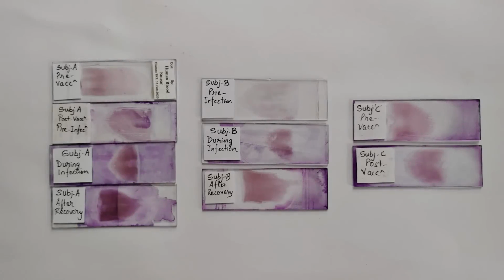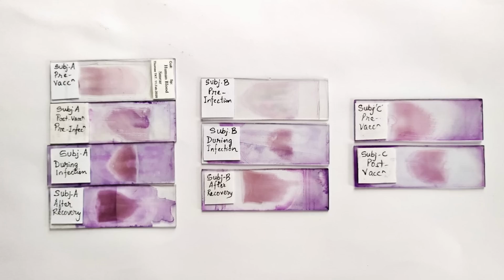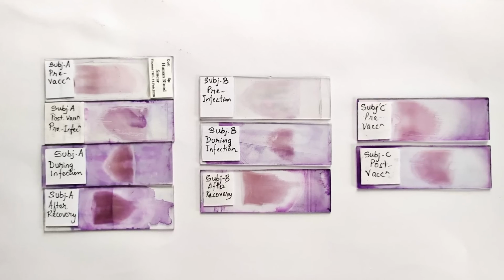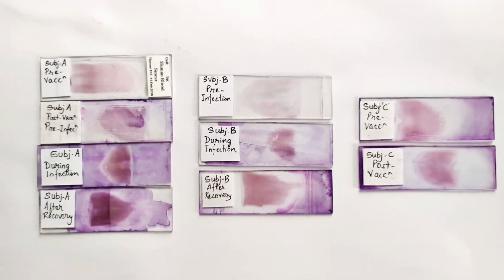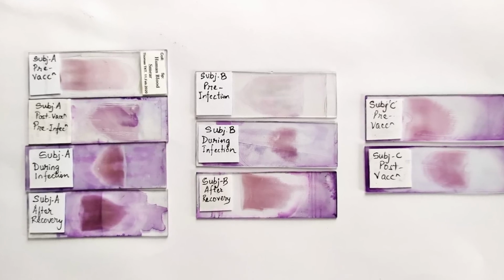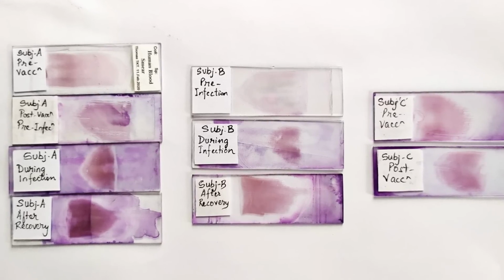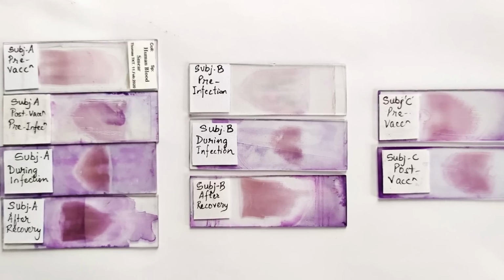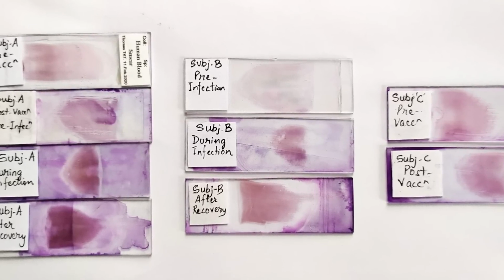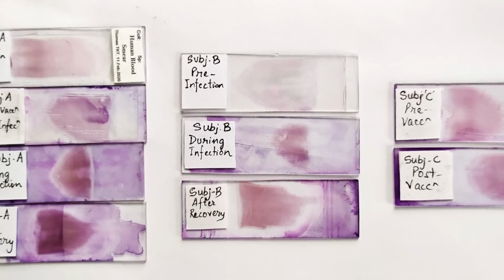Anyways, once blood smear samples from the various time frames mentioned in the table were collected, it was just a matter of hours and hours of examining each slide under the microscope one after another to look for signs or the lack thereof of anything potentially suspicious or unusual that could raise eyebrows or even a red flag. I examined individual red blood cells, including each of the white blood cell types and also including the platelets or thrombocytes of each sample of stained blood smear taken of all the 3 subjects pre- and post-vaccination, and also samples before, during, and after infection.